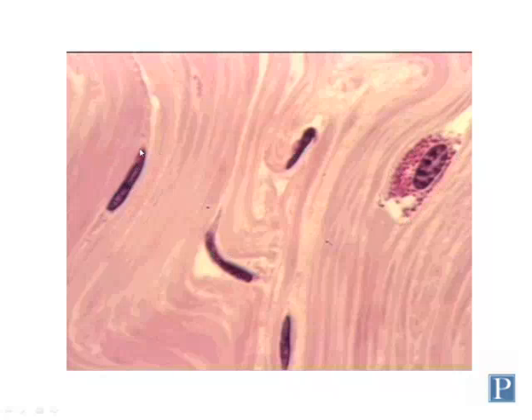This is actually a high magnification view, and you can see a little bit of the cytoplasm here towards the sides. But note that these cells are very skinny, and their cytoplasm is scant, giving a kind of tapered end or spindle shape appearance here. This is characteristic for the state of most fibroblasts in adult tissue that has been developed. And in this state, fibroblasts are said to be quiescent or inactive, in which they are only doing minimal amounts of cellular activity, maintaining the tissues.